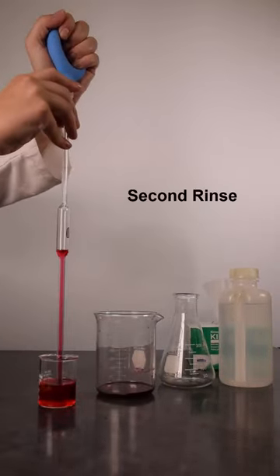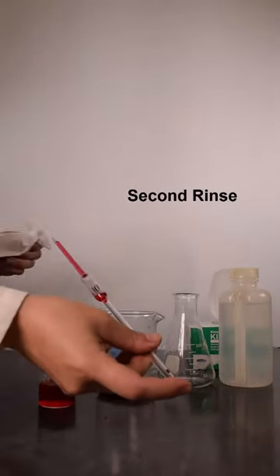Wipe the tip with a kimwipe again. Repeat this rinsing process two more times for a total of three rinses.